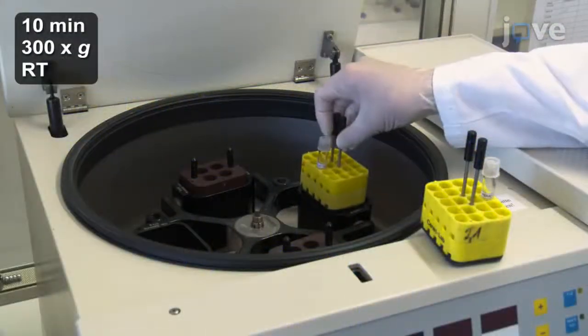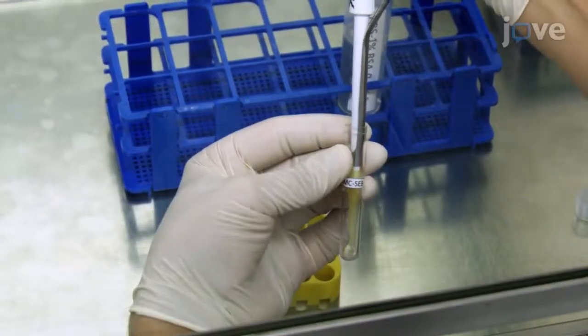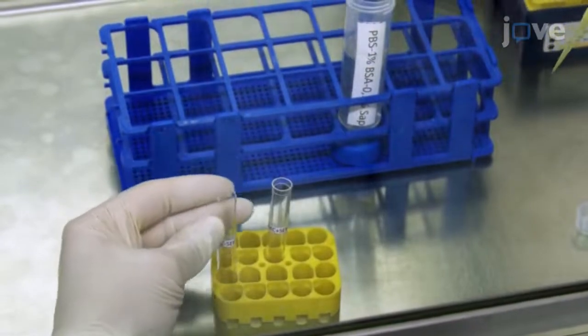Spin down the co-cultures and resuspend the pellets in 150 microliters of fresh culture medium for a 45-minute incubation at 37 degrees Celsius.